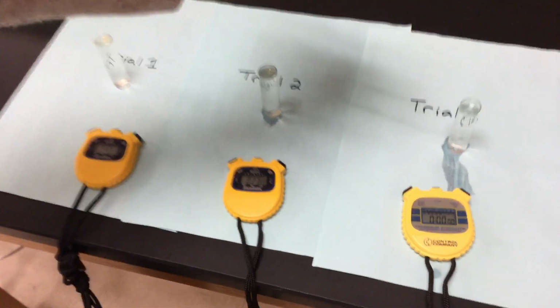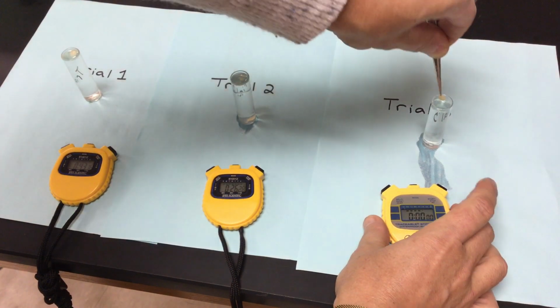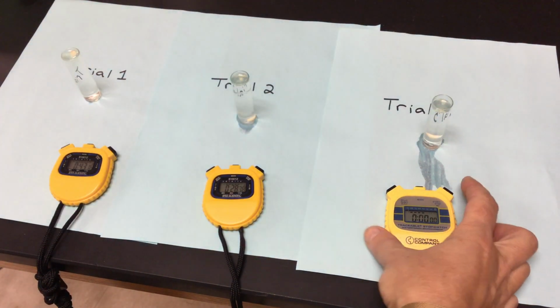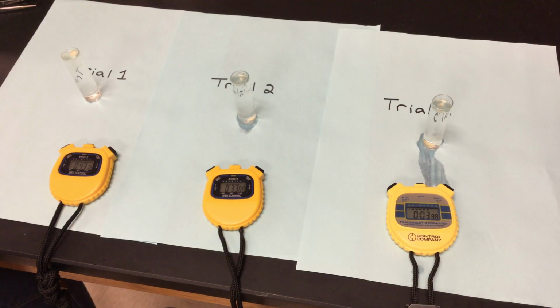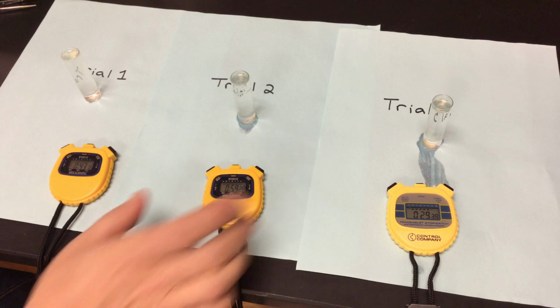We're going to stick trial number 3 in right now. We'll come back and talk about trial 1. Put that in. Let it drop down to the bottom. Click my time. So trial number 1 was already done. It was 43 seconds was my total. We're waiting for trials 2 and 3. So a little bit quicker than what we saw with pH of 5, and definitely quicker than what we saw with pH of 3. So the enzyme definitely likes this particular pH just a little bit better, but we still have pH of 9 as well as a pH of 11.